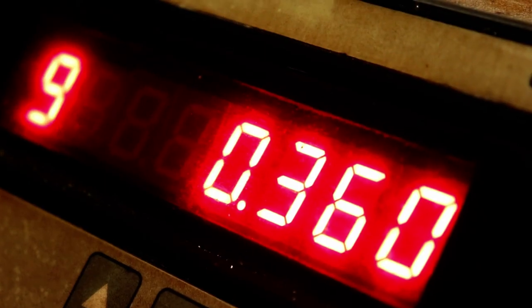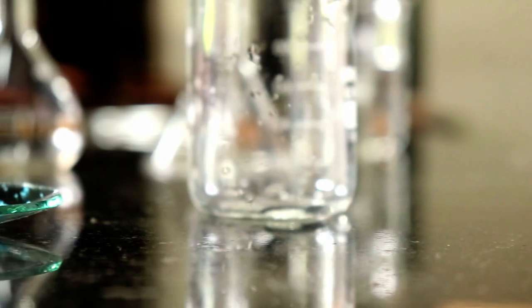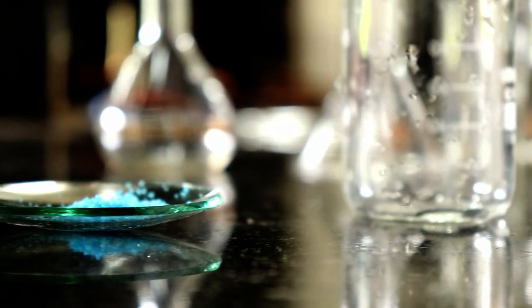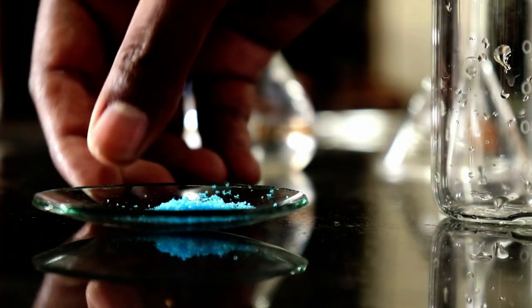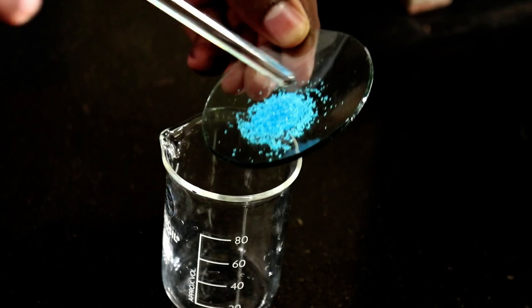Always use a watch glass to take the weight of the substance. Use a dry glass rod and transfer maximum solid to the beaker.